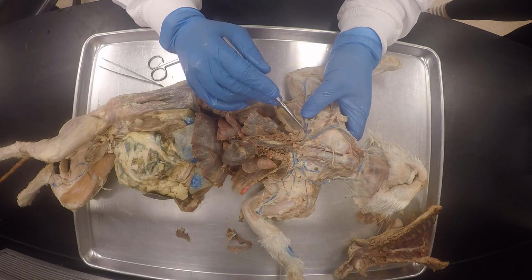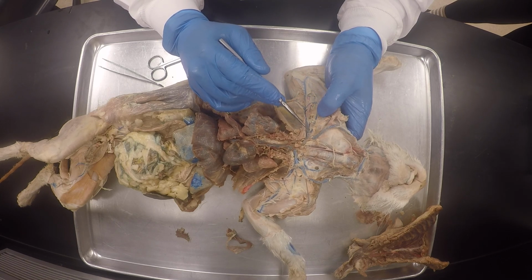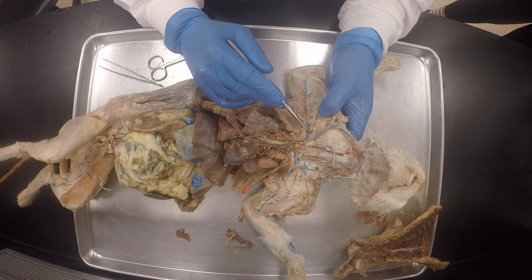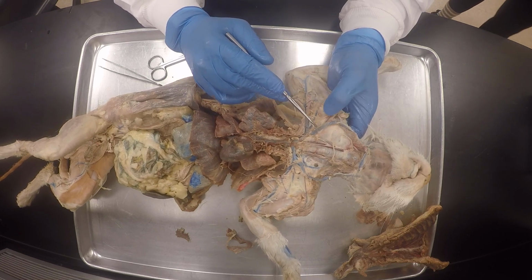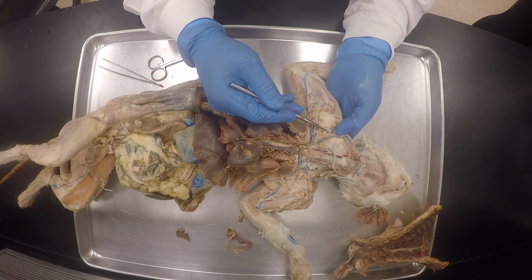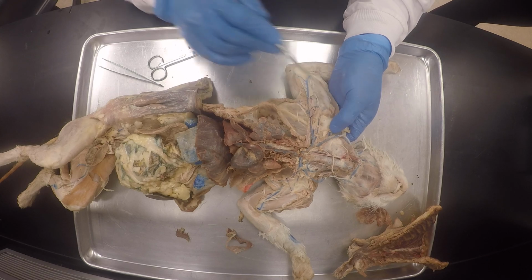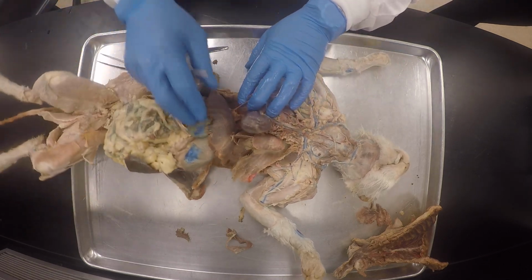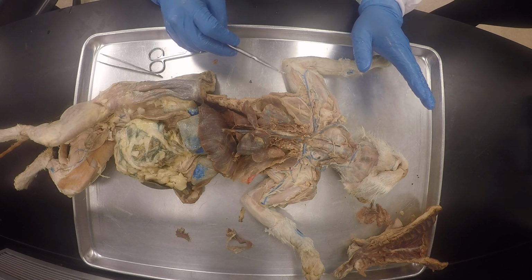So there's the subclavian, maybe very short over here, subclavian, and then axillary, subclavian vein, brachiocephalic vein, external jugular vein, okay, and then there's our transverse scapular artery and vein, but they're separate. Usually I do them separately, okay. So I think I'll stop this for the cranial arteries.